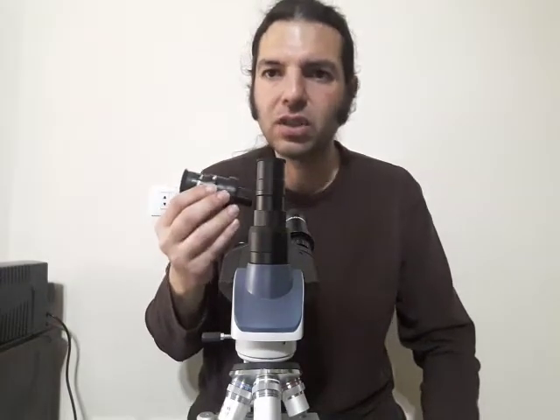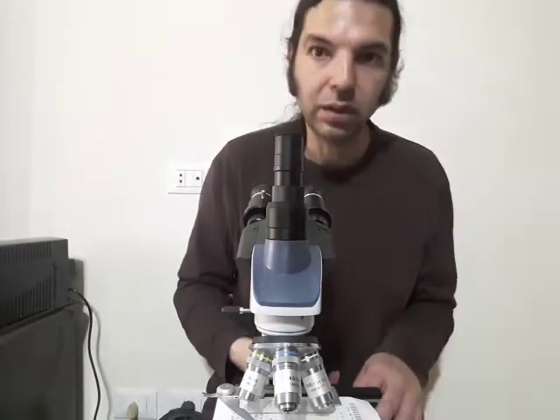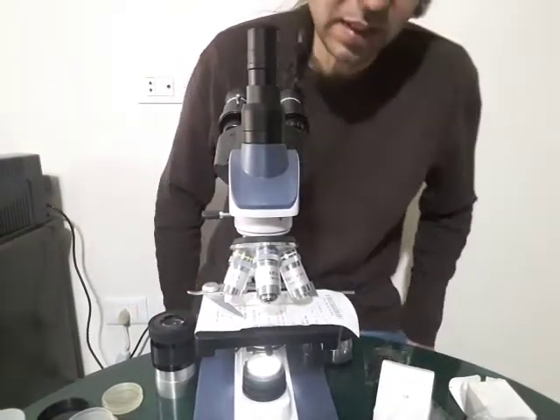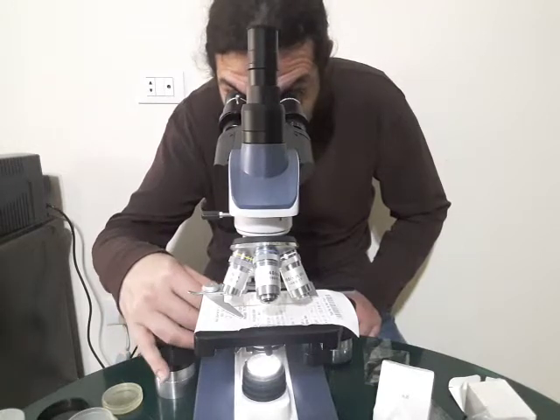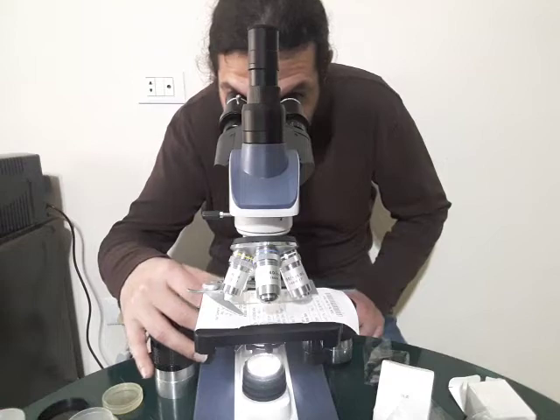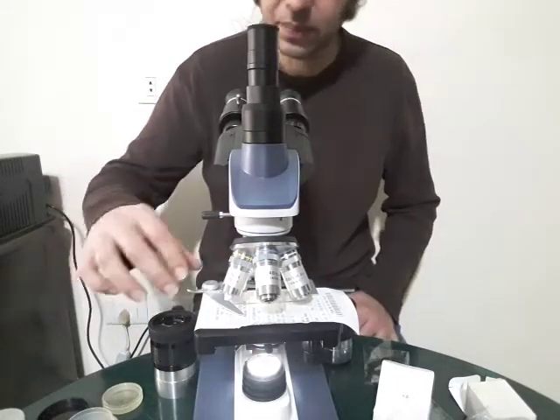Generally this is what I do with a telescope on a microscope — I think it'll do the same, so just try it. If it doesn't focus, use a Barlow, or switch the objective lenses here because they are switchable. These are the available objectives. I'm going to turn on the light below. This is a white paper so the light can pass through and you can magnify the letters on the receipt. Here I use the focuser below. It's easy to use the 1.25-inch eyepieces. I have the maximum, which is the 100x objective.